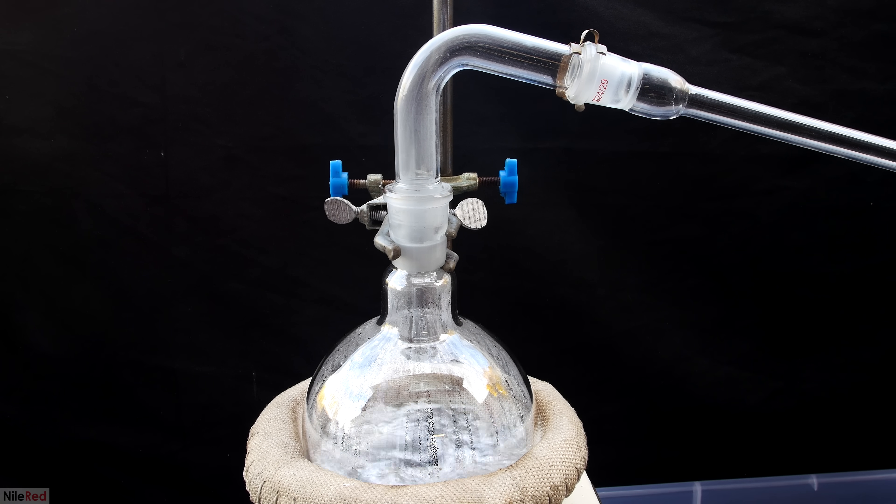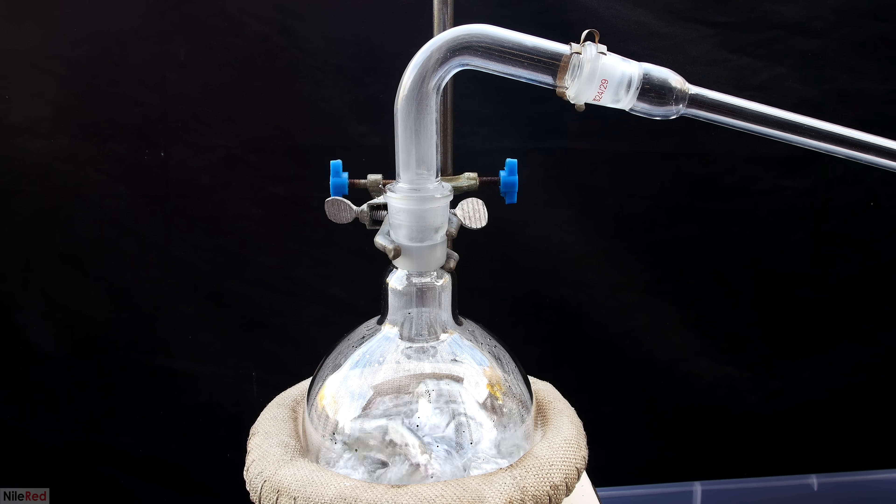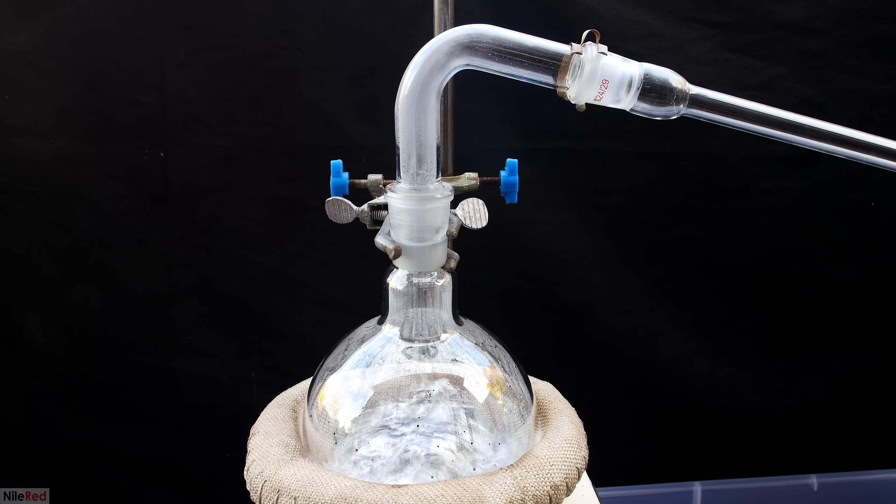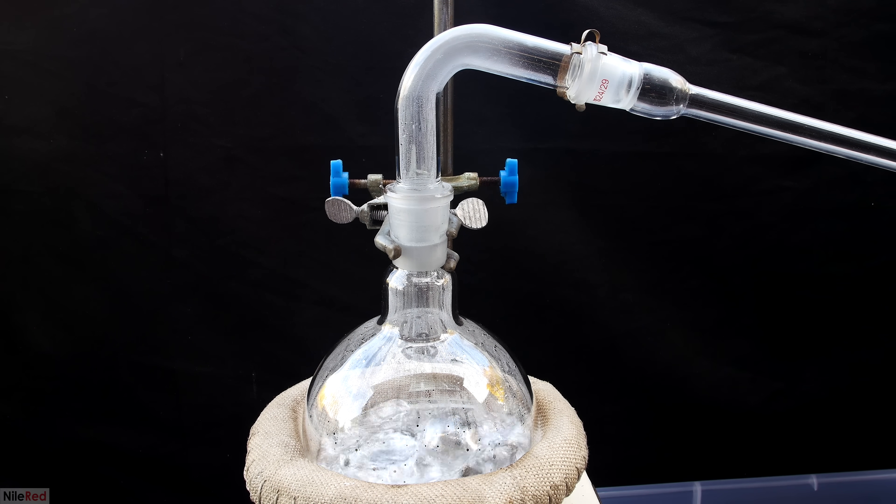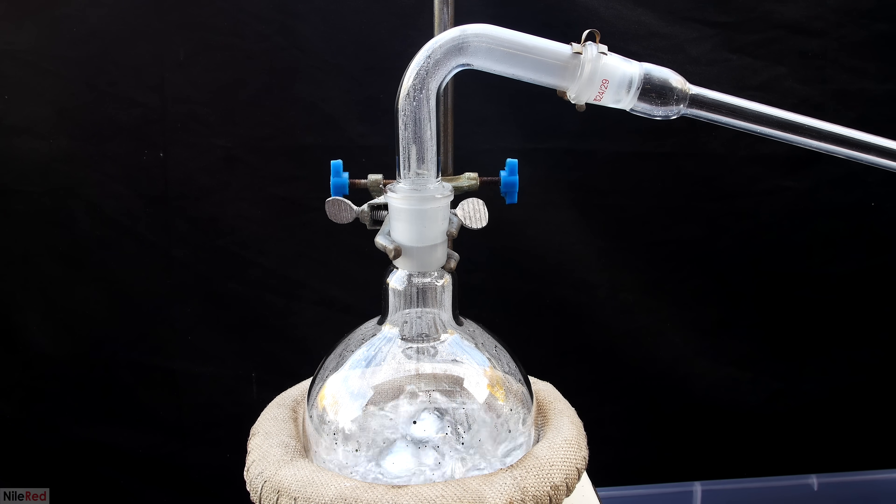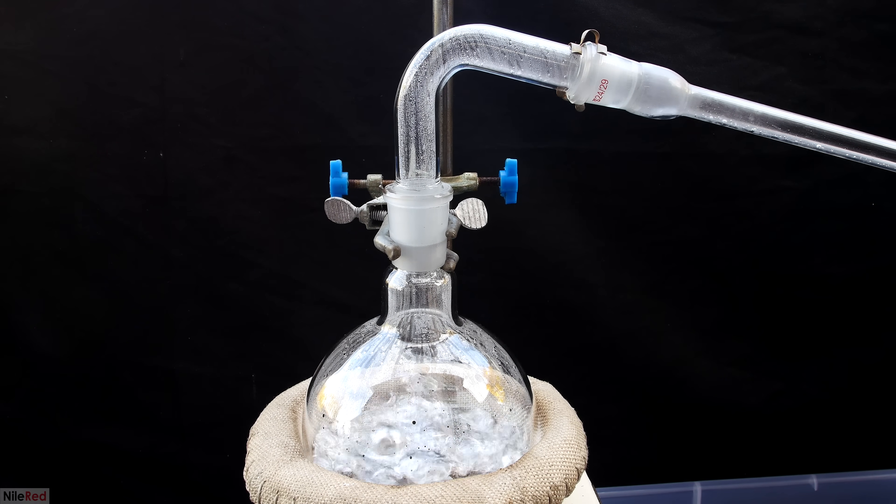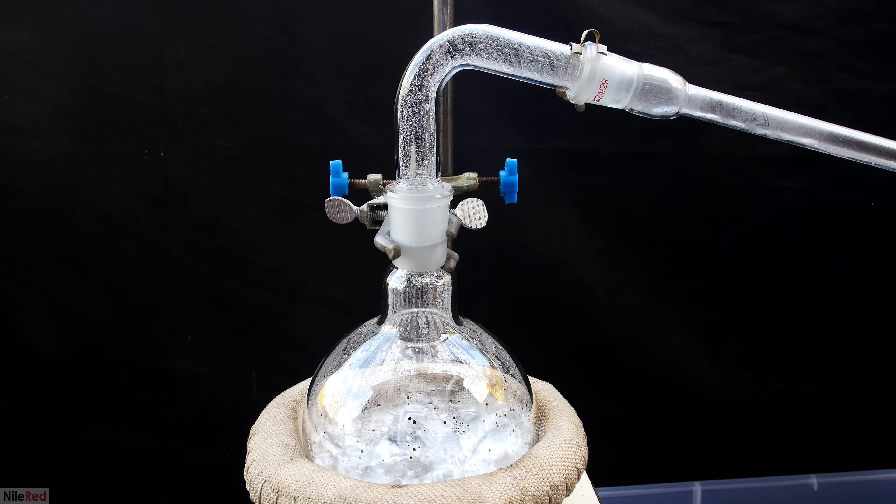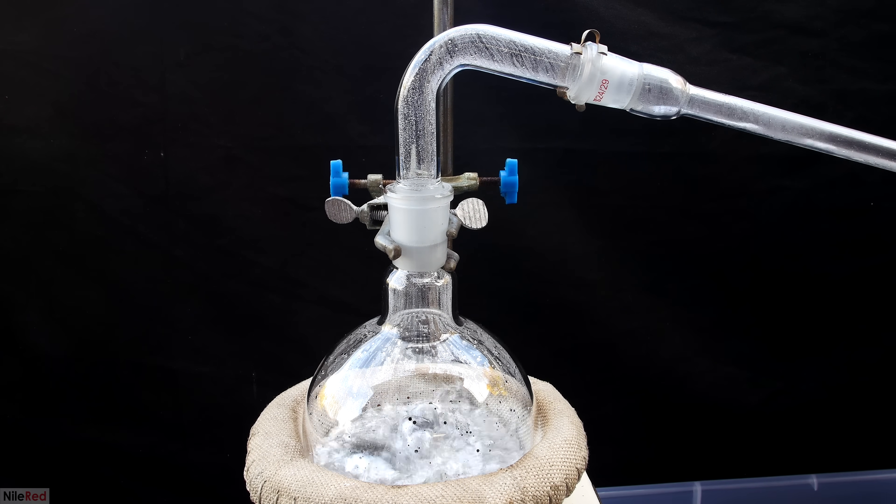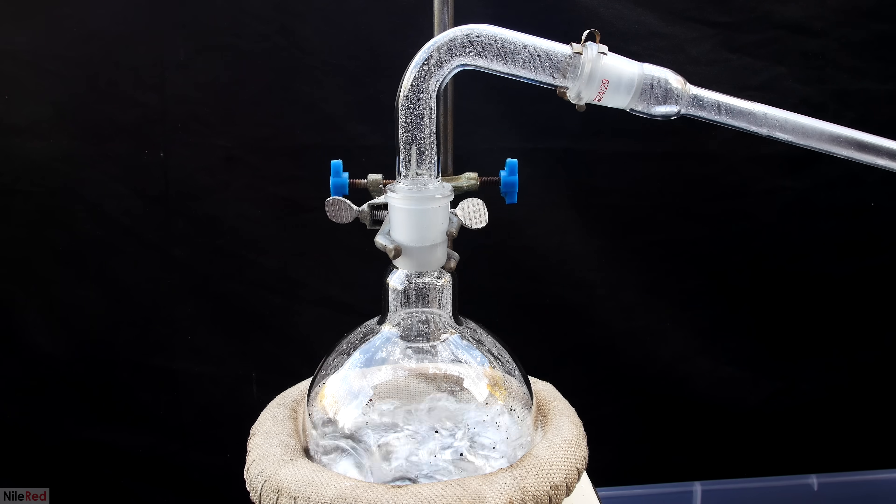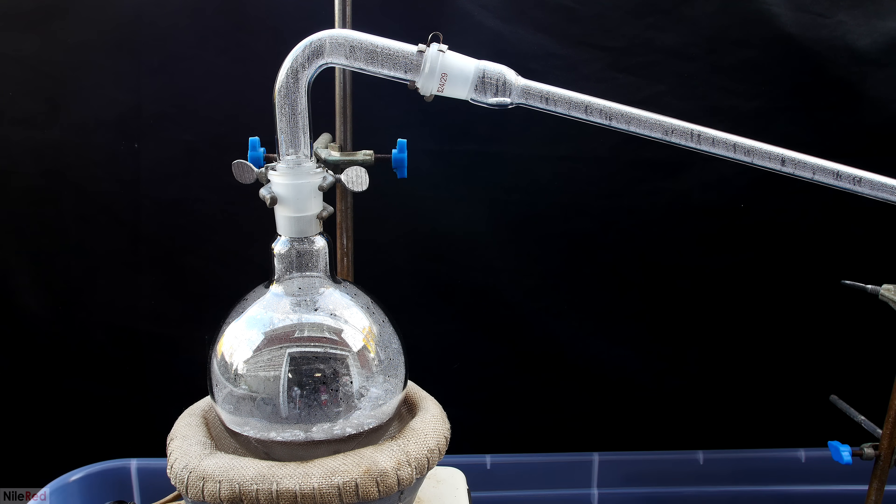It eventually achieves a decent seal, so the vacuum pump is able to drop the pressure, and then the boiling just takes off. I don't think I have to tell you guys that this is really dangerous, and it should be stopped immediately. I honestly let it go on a little bit longer than I should have though, because I wanted to show you guys the violence of it. To stop things, it's pretty simple, and we just have to take it off heat. So using the lab jack, I lowered the heating mantle away from the flask.